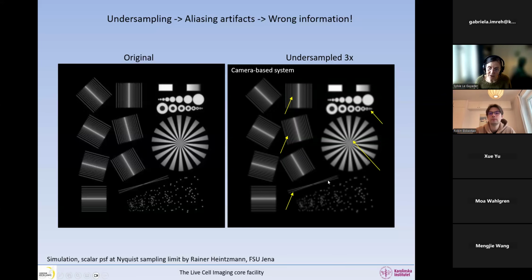But if we look at the stuff that looks a little bit closer to our microscopy sample, what can you see? You can see in here that these 3 dots that were resolved are actually not resolved anymore, and they make like a little banana like this. But we can see in here that we also have something that looks like it's elongated, whereas it was just a simple dot. All these dots have the same intensity and the same size to start with. And if we look in here, we have another strange banana, and one of these dots looks much dimmer than the others, even though in here it looks the same, and we resolve them.